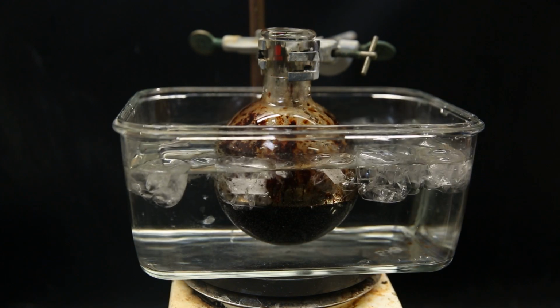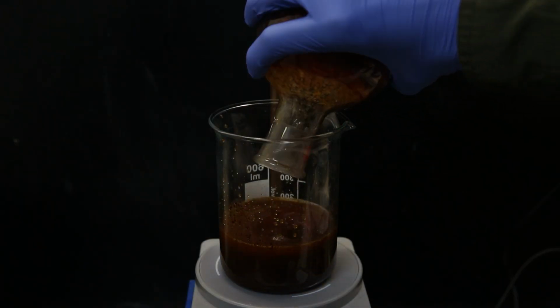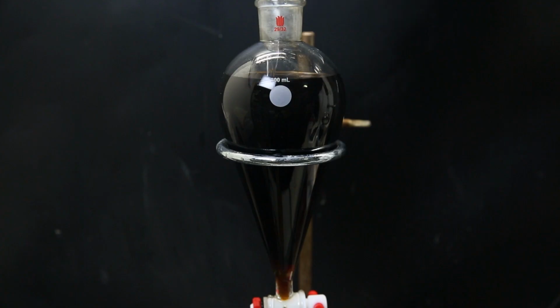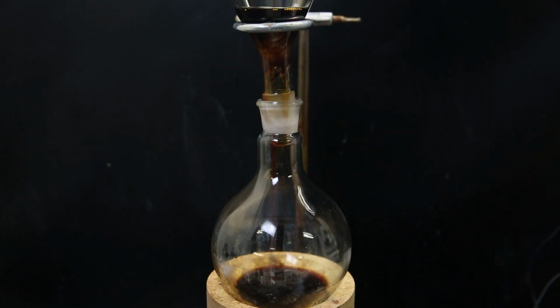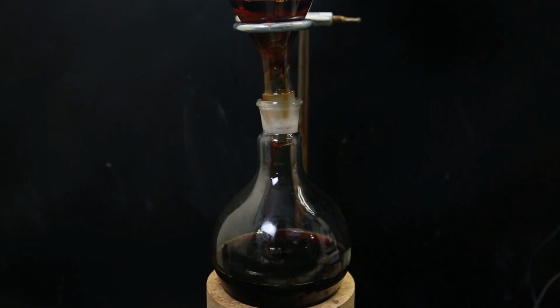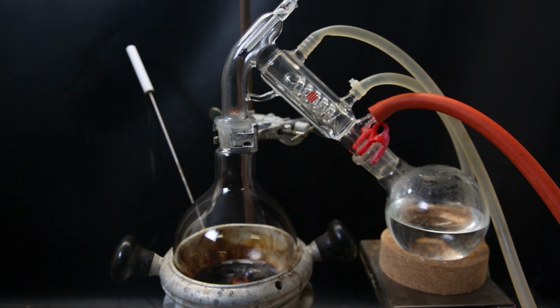After the addition, and then leaving it to stir and cool overnight, I diluted the mixture with water, and added ethyl acetate to extract it. I then washed the extract with brine, and dried it over anhydrous sodium sulfate. I filtered it all through some cotton to remove the sodium sulfate, and then distilled off all of the ethyl acetate to be left with a thick red-black tar.